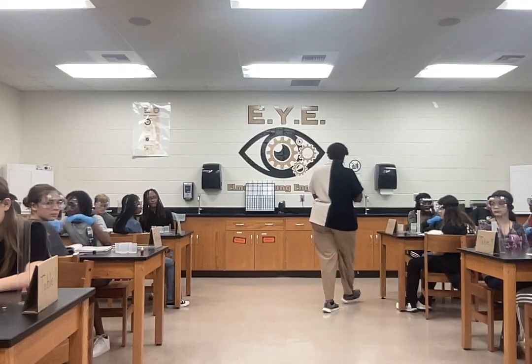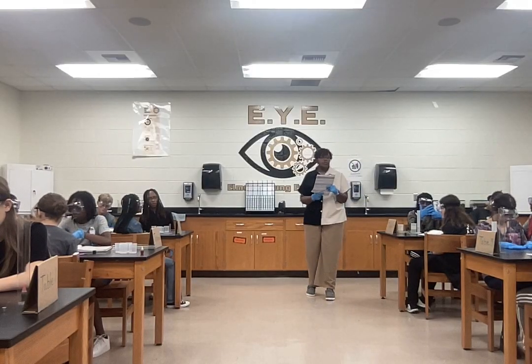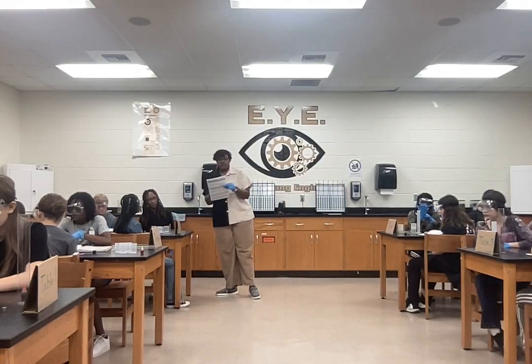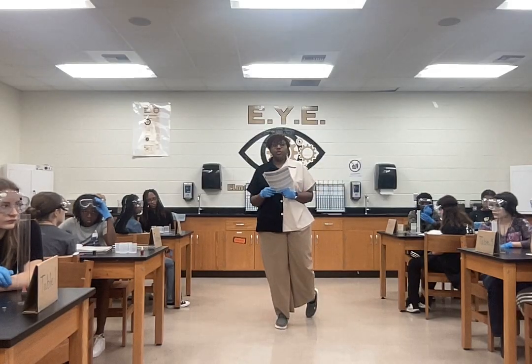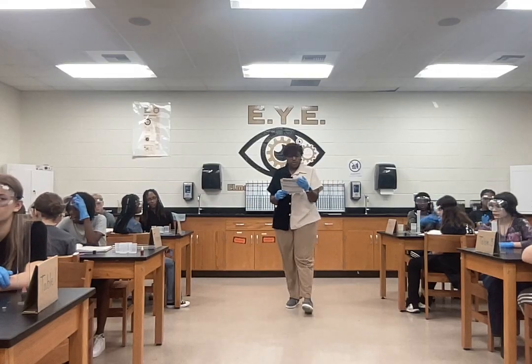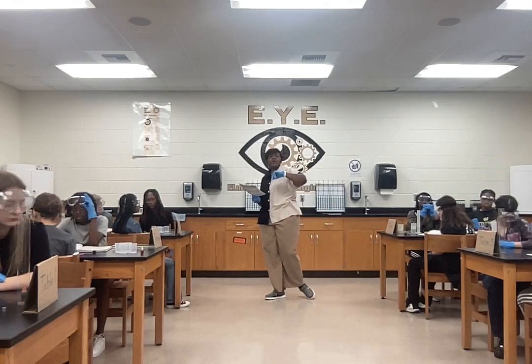So for the mass of the graduated cylinder and water at 0 milliliters of water, it's still going to be 34.86. Then when we add 25 milliliters of water, how much did you tell us it was, Haley? 74.44, right? Now, for just the mass of the water, we have to subtract the graduated cylinder.